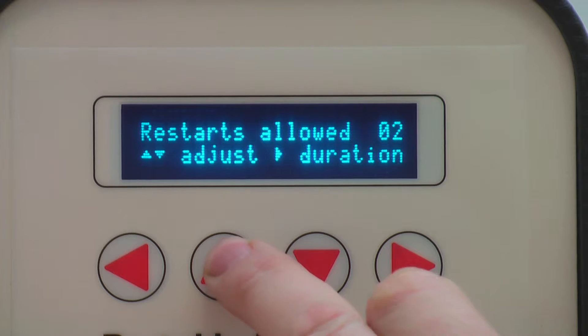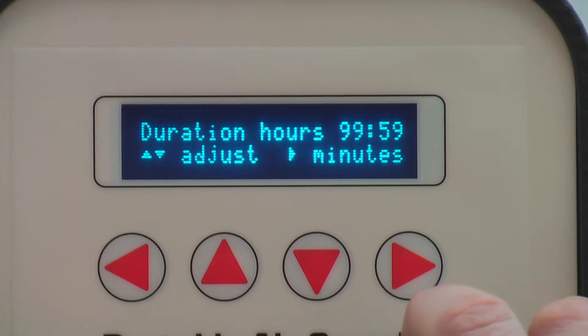If there is a power cut during sampling, the L60IF can be set up to either resume the sampling as before the power cut or stop the sample altogether and issue a fault alarm.